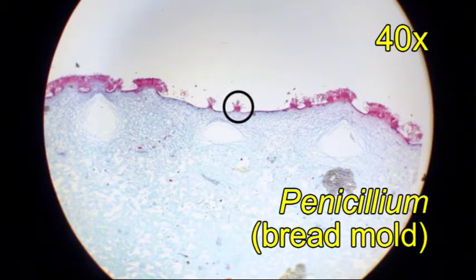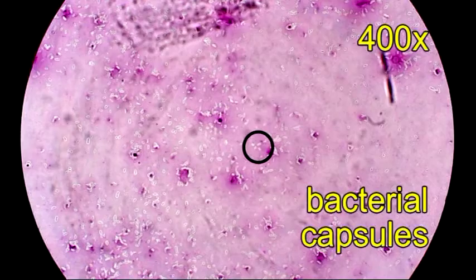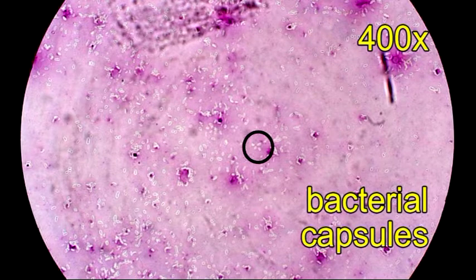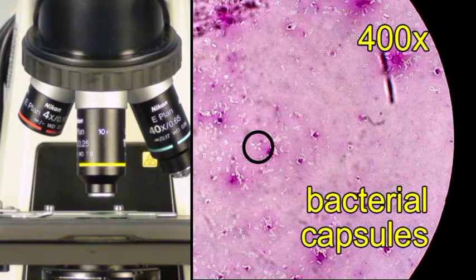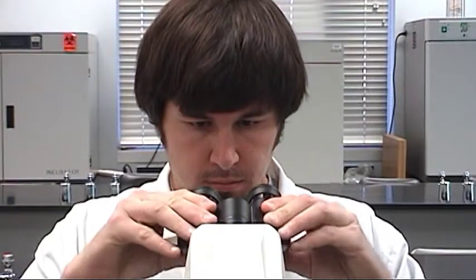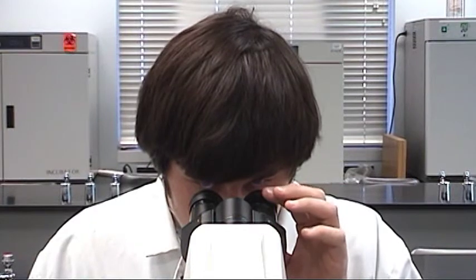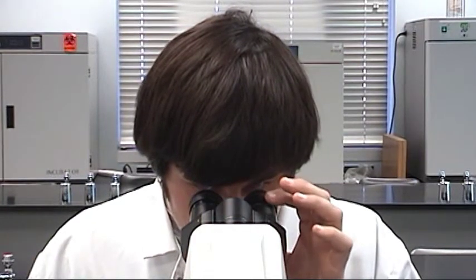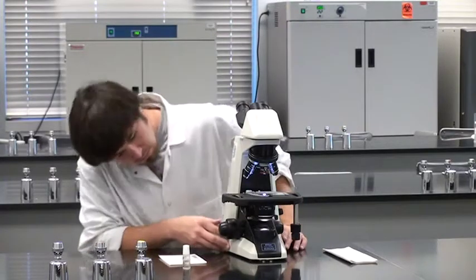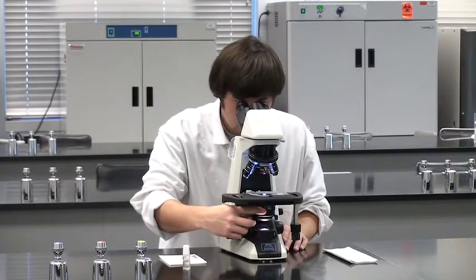Large multi-cell organisms, such as molds, can be seen easily, so start with the scanning objective. Small single-cell organisms, such as bacteria, cannot be seen with the scanning objective, so start with the low power objective. Next, swivel the oculars to match the distance between your eyes, which is called the interpupillary distance. Then adjust the oculars.